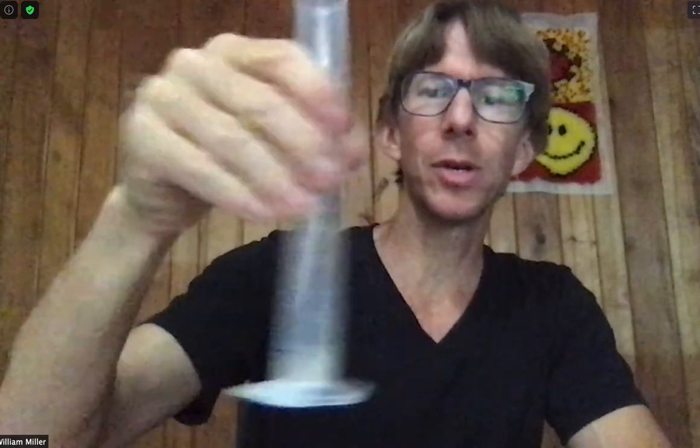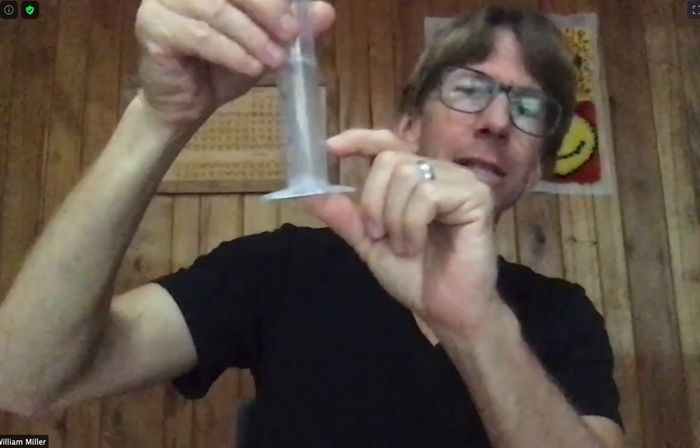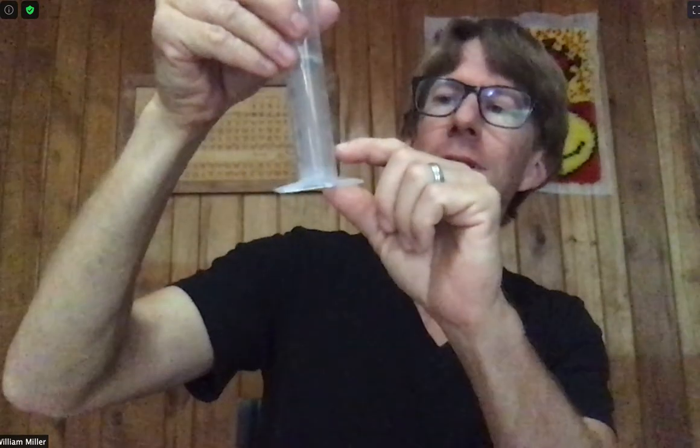So the only option is to swirl. And when you do that, you should see — they're not very photogenic, but look in your graduated cylinders. You should see swirlies, and those swirlies are density fluctuations due to the dissolving of salt as it mixes with the water above it.